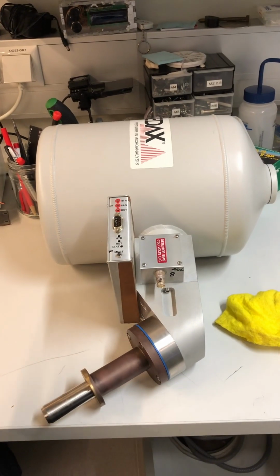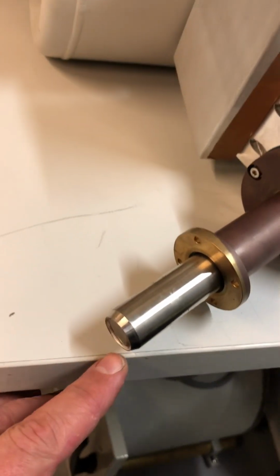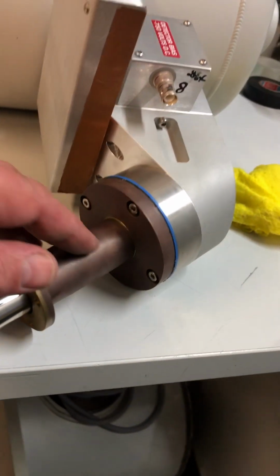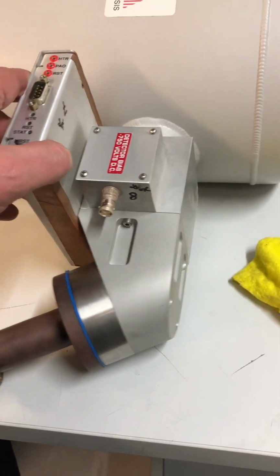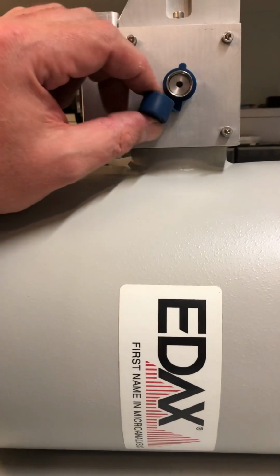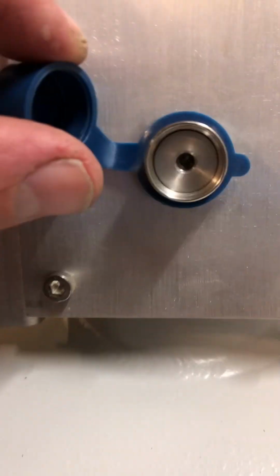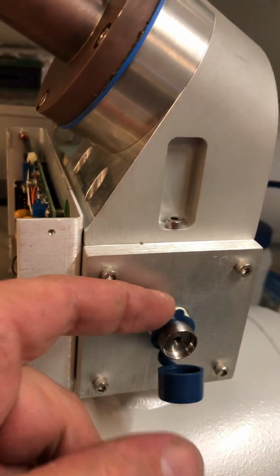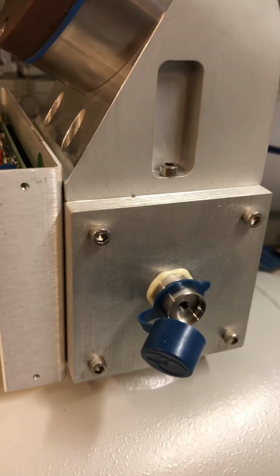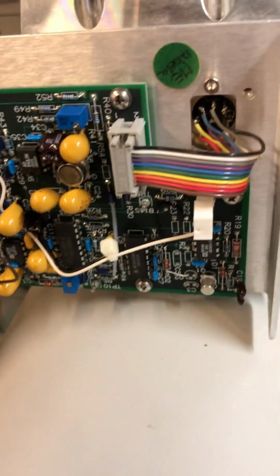Assembly connected to the liquid nitrogen cryostat. Here we have the detector window with a beryllium thin window, and it could be inside vacuum here, so I don't know where to start to disassemble. On the opposite side is such a lead marked with omega, and it might be a vacuum suction port. I'm not sure, I have never seen such a thing before, and it's glued with some Torr Seal glue. Yes, indeed, inside everything is in vacuum. I should not open it.